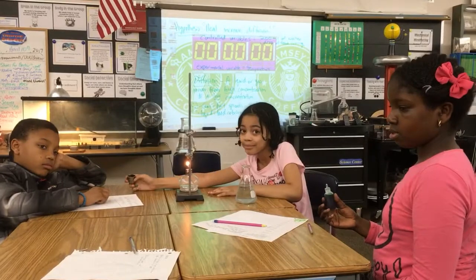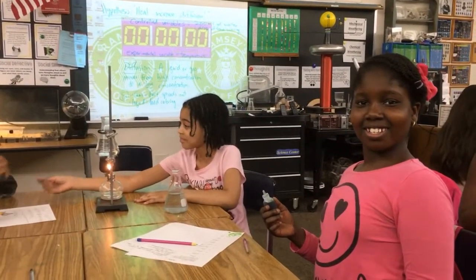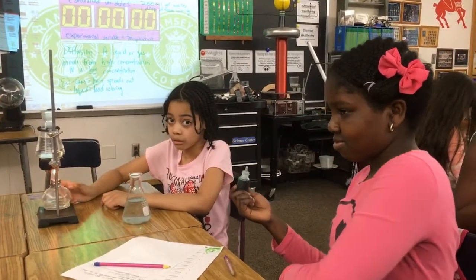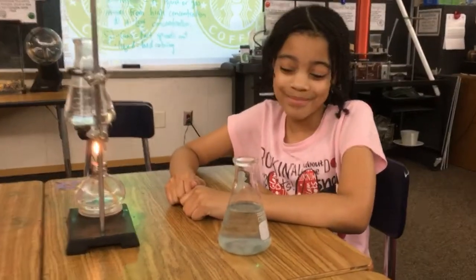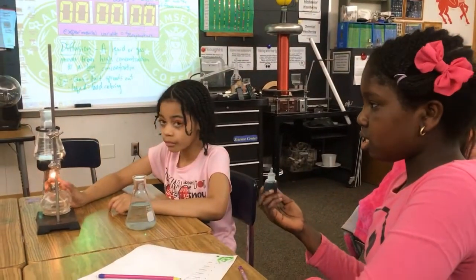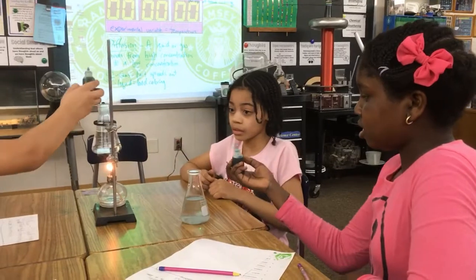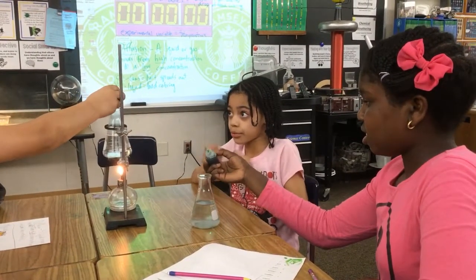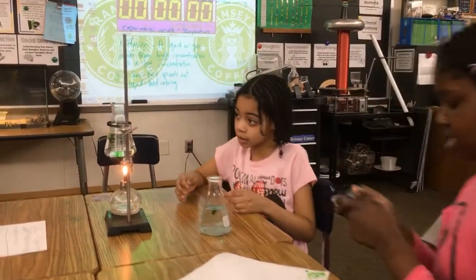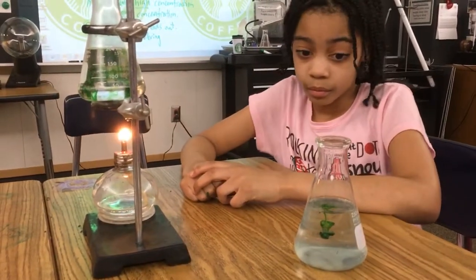Good job. I'm here with table 2 for our second diffusion test, and we want to see if temperature increases diffusion. So, Gift, we have 1 flask that's boiling, and Gabby, the other flask looks like it's room temperature, and you guys are going to add 1 drop of food coloring at the same time, and we're going to see which one diffuses the quickest. On the count of 3. 1, get ready. 2, 3, add your food coloring. There we go, okay. Let's see which one diffuses more quickly.